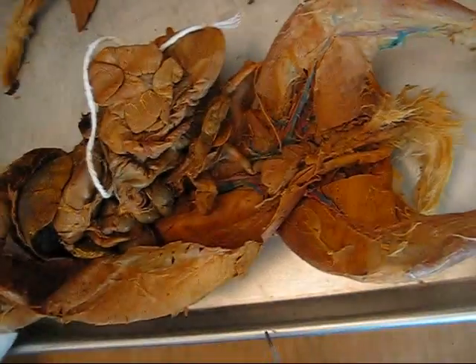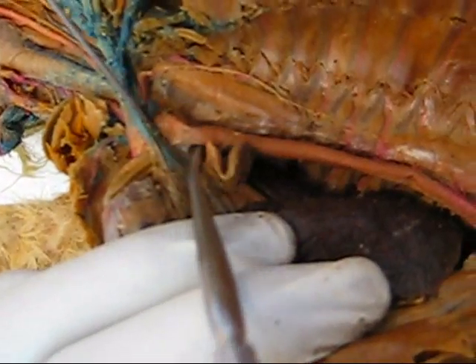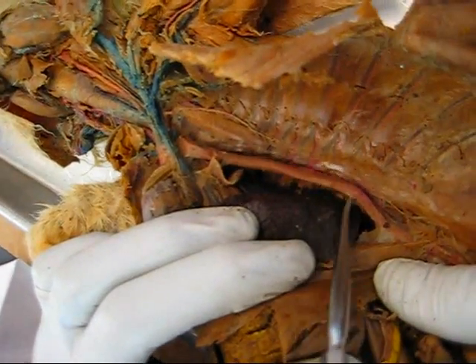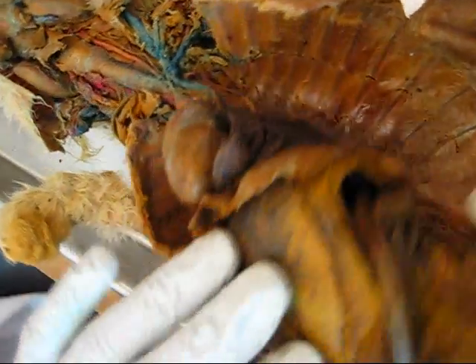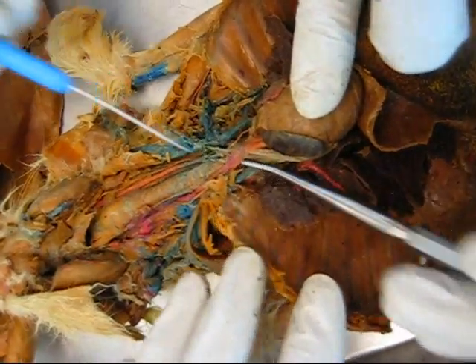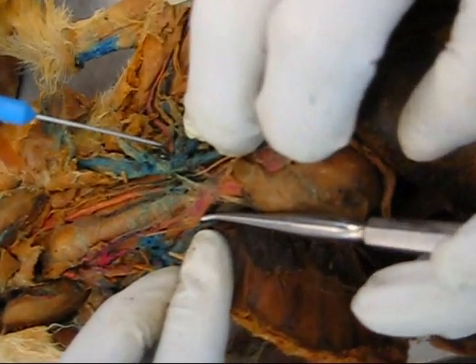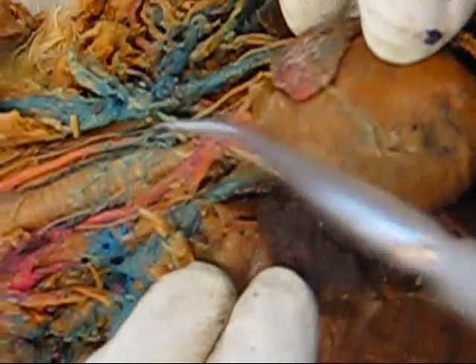Going on to the circulatory system. Here we have the aortic arch. Thoracic aorta — branching down from the aortic arch and through the diaphragm is the thoracic aorta. Brachiocephalic trunk is on the right side. Right subclavian artery — branching from the brachiocephalic trunk — is here. Right and left common carotid arteries — these are the common carotid arteries. Left subclavian artery is here.